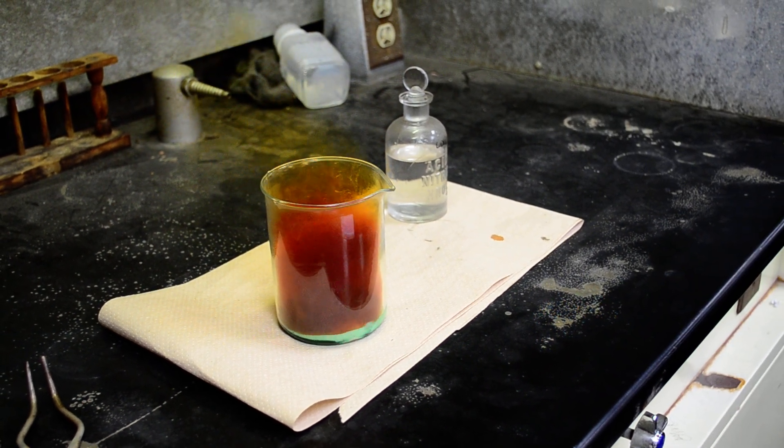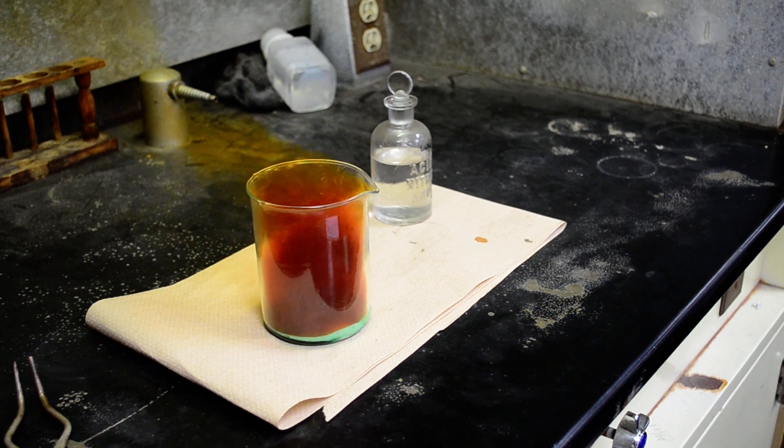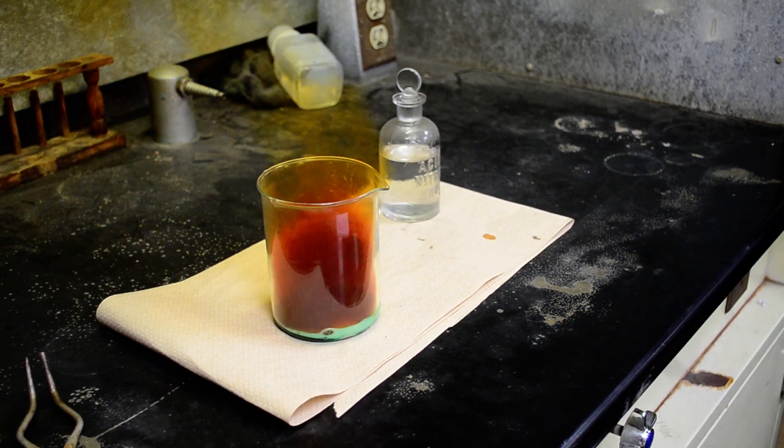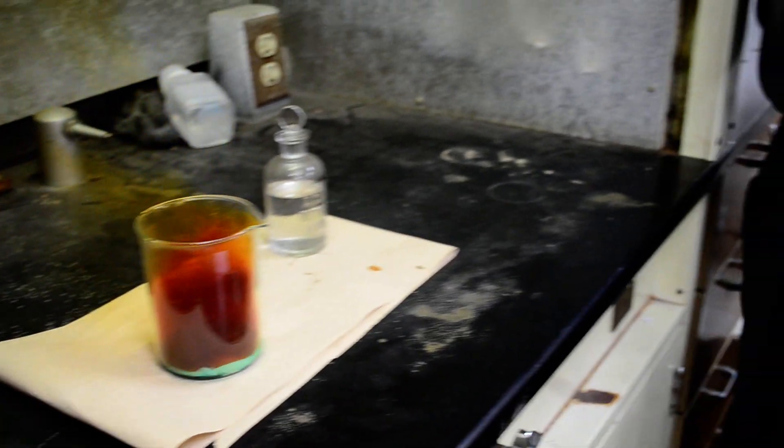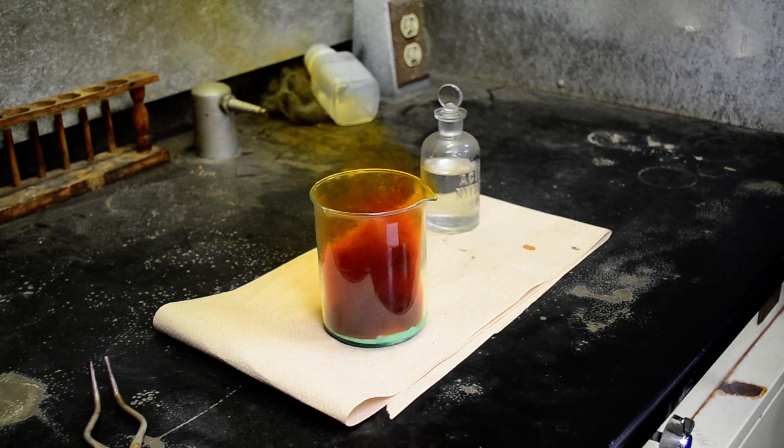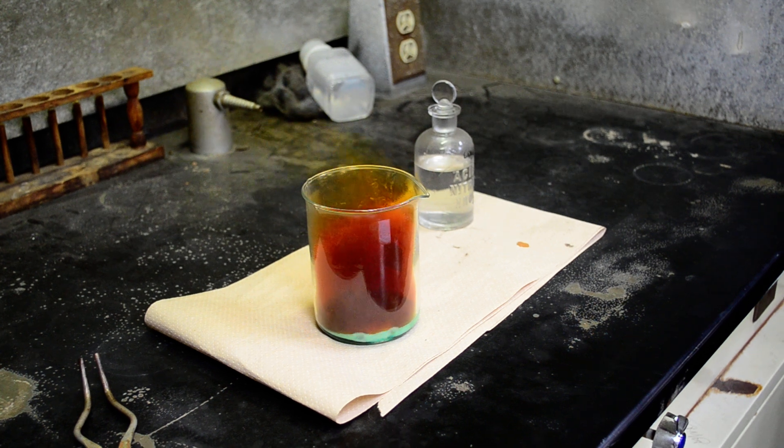We're going to let that cook for a little while. Then I'm going to stop the reaction, or at least slow it down significantly, by adding water. You'll notice I have that hood on.